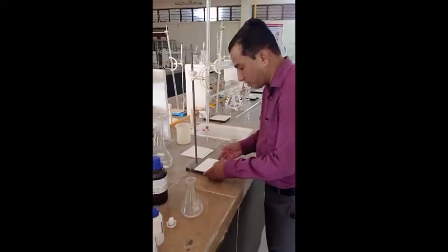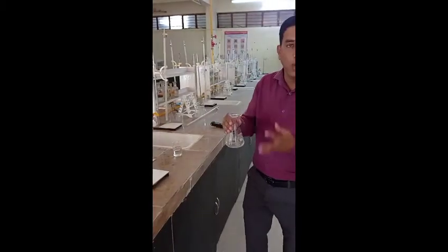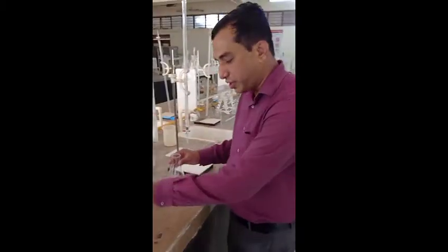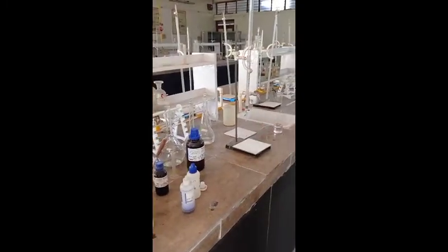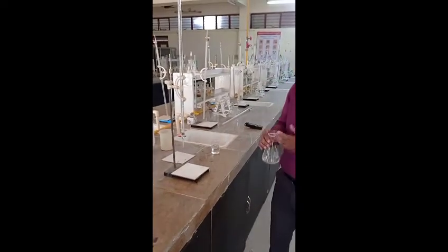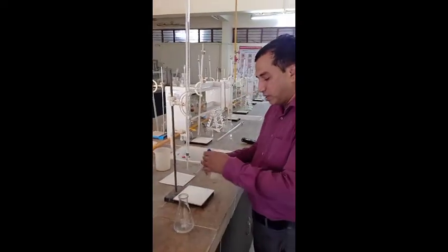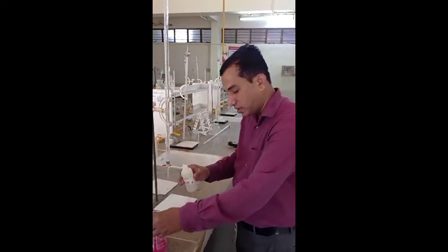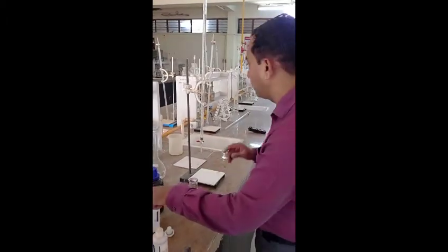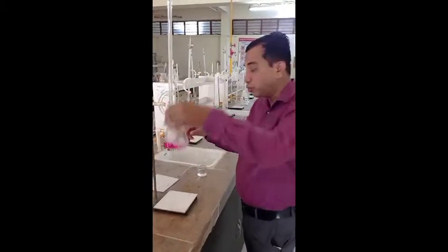Alkalinity is basically checked by neutralization titration, where we take standardized HCl in the burette and pipette out 25 ml water sample to calculate alkalinity. We use two indicators: one is phenolphthalein and another is bromophenol blue, to find out which ion is responsible for alkalinity and how much of that ion is present. First we add two drops of phenolphthalein indicator — the solution becomes pink — then we titrate this against hydrochloric acid up to the color change from pink to colorless.